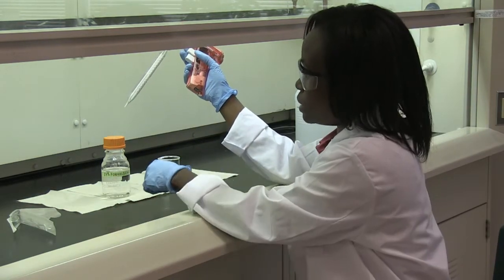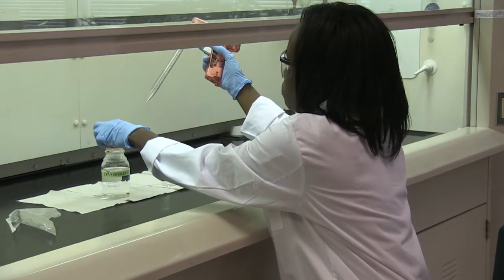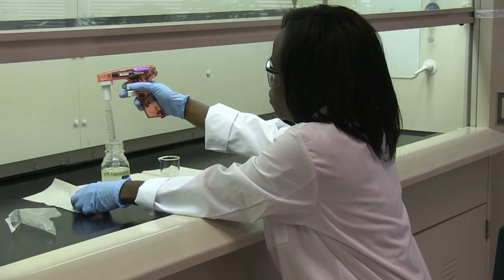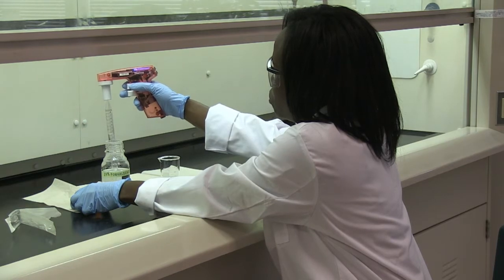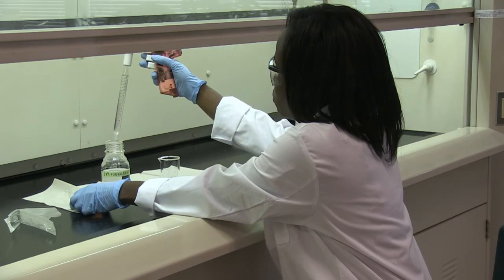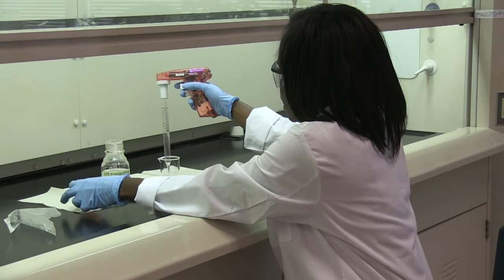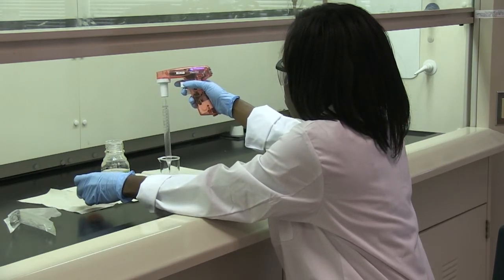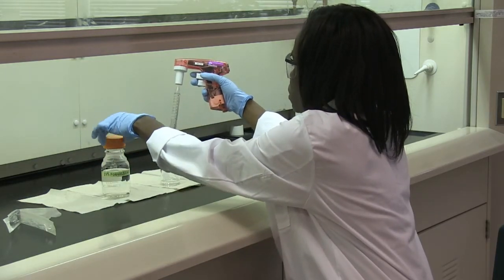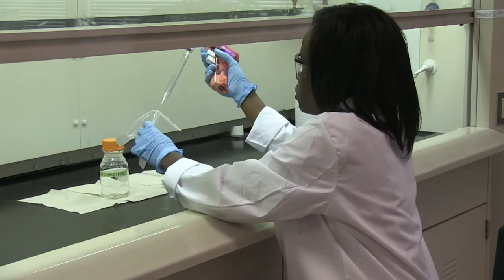Formaldehyde in particular is a cancer-causing agent. Gently remove the cover from the bottle, immerse the pipet into the liquid, slowly pull the liquid up to the desired volume, then transfer it into your beaker. Immediately after you finish using the liquid, close the bottle and secure your pipet.